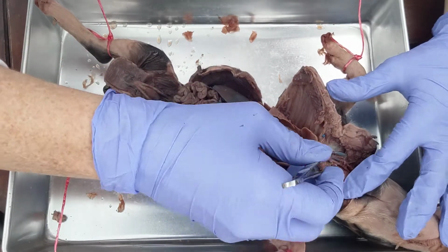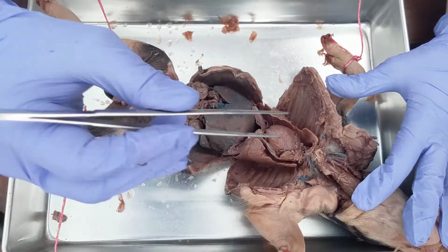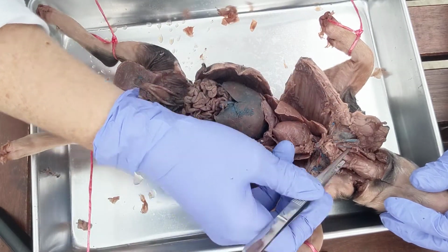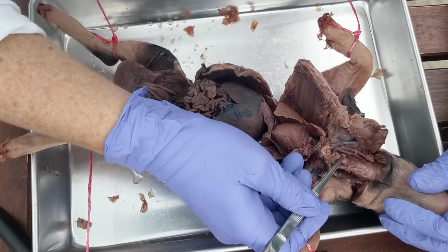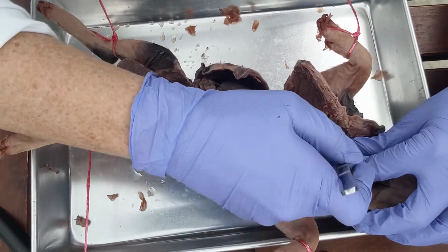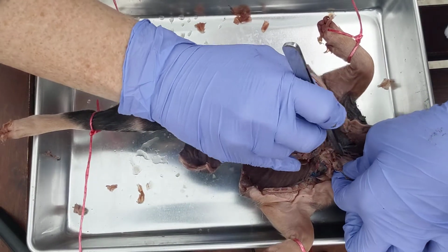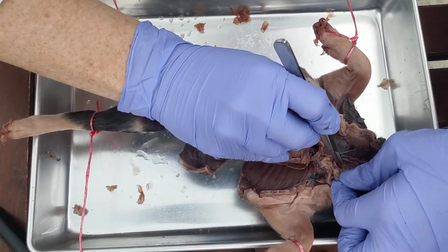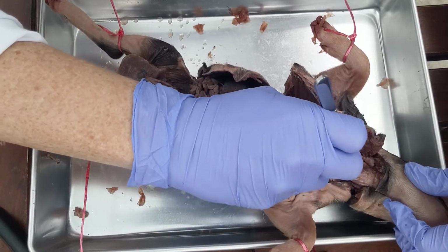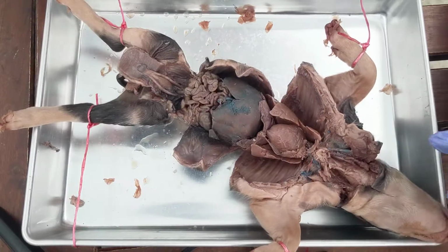If you kind of remove all of that, you will get to a tube that has a striped appearance. It definitely has a very specific, noticeable texture. That is the trachea. Okay, so here's the trachea. Immediately behind the trachea is a very soft tube. That is going to be the esophagus. So if I can move that nerve out of the way, this soft tube immediately behind the trachea is going to be the esophagus. And then further up here, that would be the larynx.